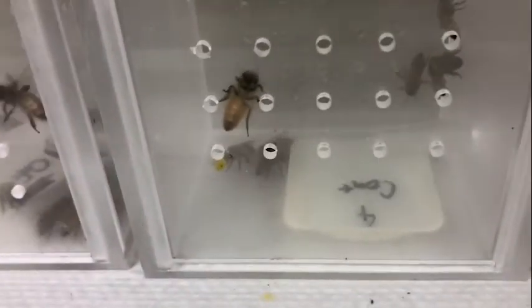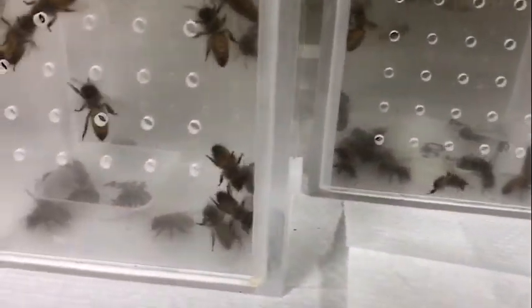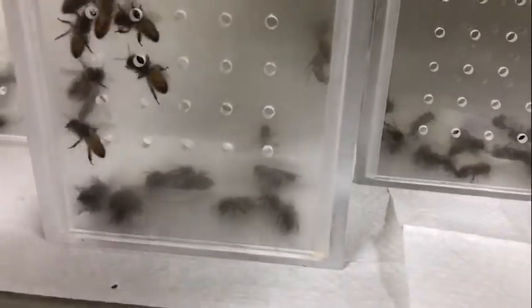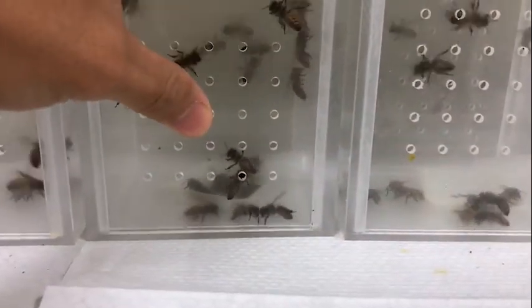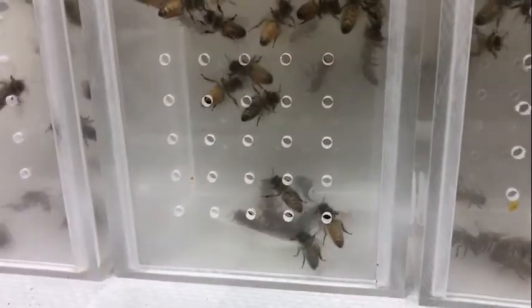And so we can take the petri dishes like those here and make a bunch of little blobs of food, and then we can graft those really small first instar larvae out of the colony into these little blobs of food. We can set them in very carefully, so they float on there, and we can rear them to adulthood totally in the lab.